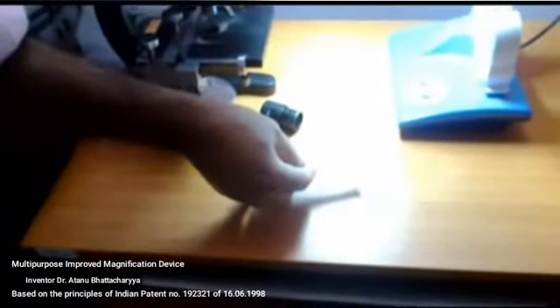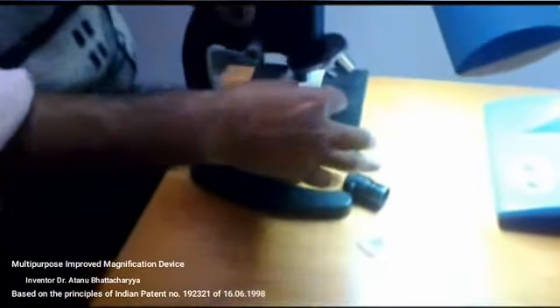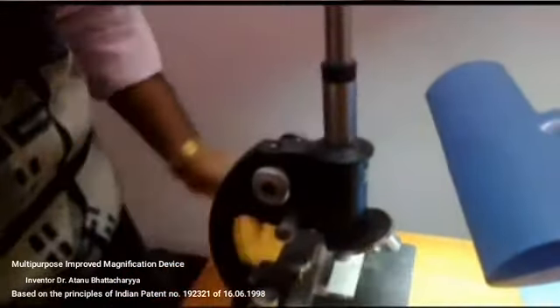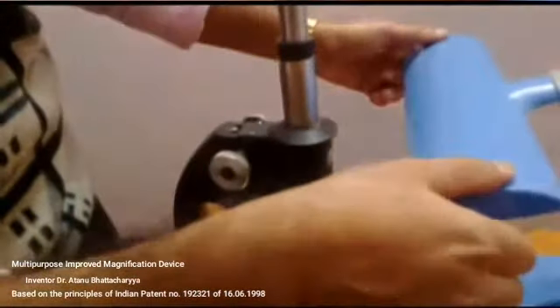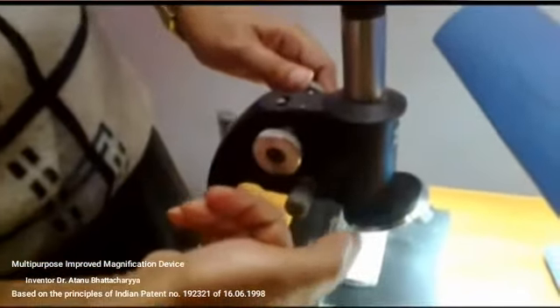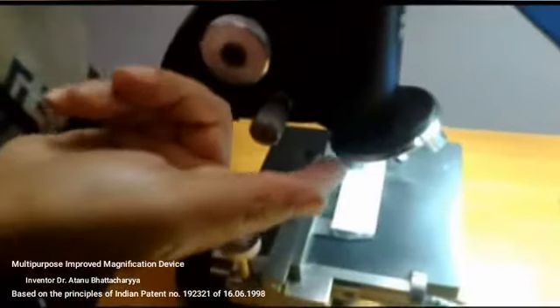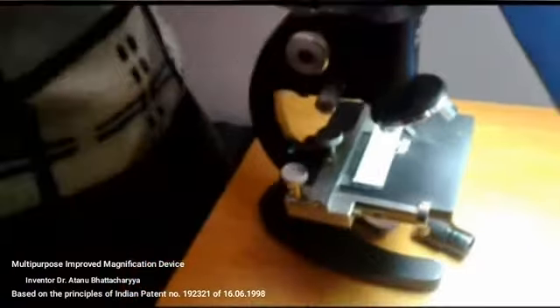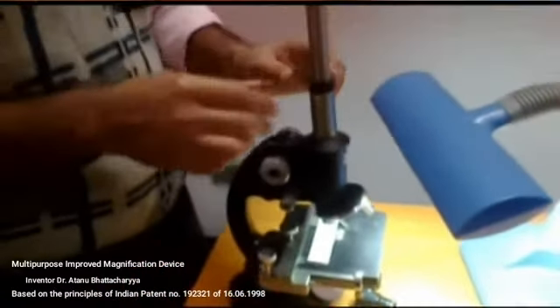This is an opaque slide with an ant on it. Now I am trying to see. First, the ant has to be illuminated from the upper side, and this is the 4x objective. For dissection purpose, a low power objective should be used. So I have brought here the 4x objective. Now by keeping the device on the microscope, I am adjusting.